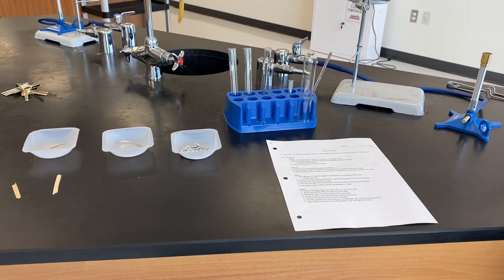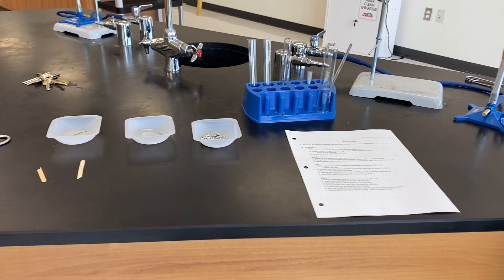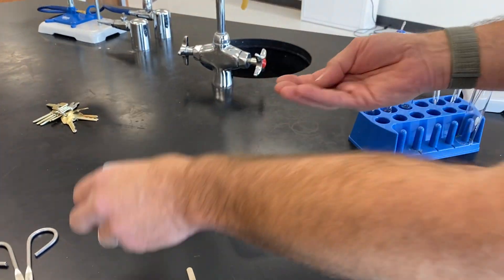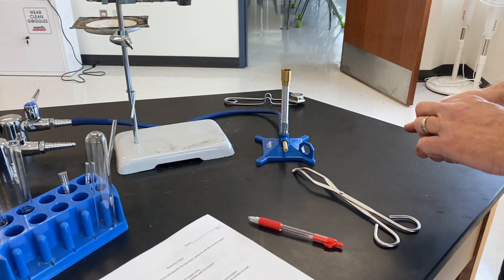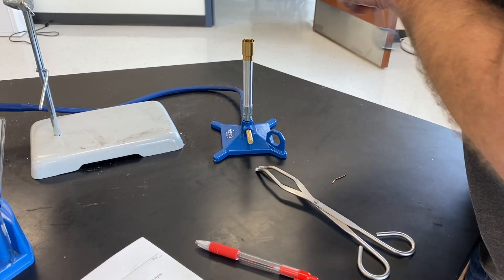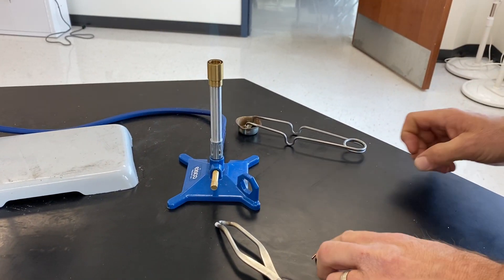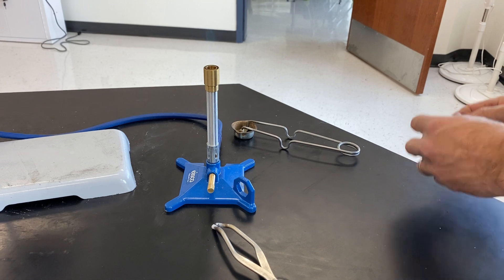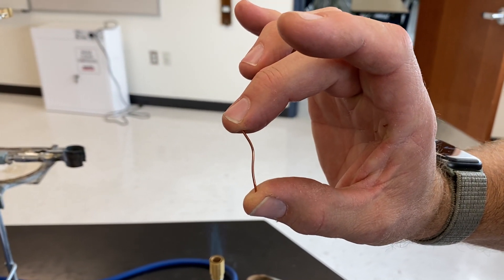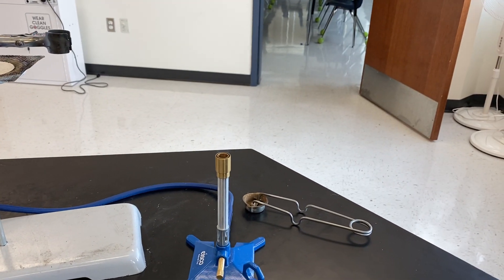The first thing we're going to do is take a piece of copper wire, which has already been sanded, and we are going to use a set of crucible tongs and place this wire in the Bunsen burner flame and leave it there for 90 seconds. So let's get our Bunsen burner lit. First of all, you want to make some observations before you get started.